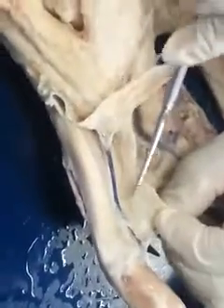We reflected the epitrochlearis. This epitrochlearis is not present in humans, so I'm not concerned with it. As we go deep to that, though, you're going to see the brachial arteries and veins, some of the nerves from the brachial plexus. The muscles we're concerned with here, the biceps brachii, obviously for elbow flexion.